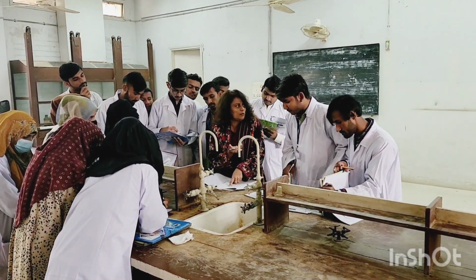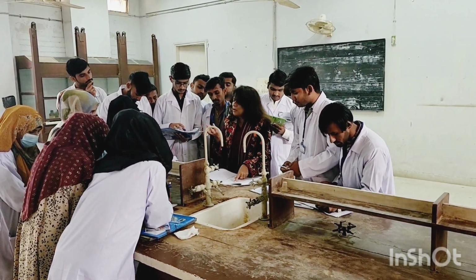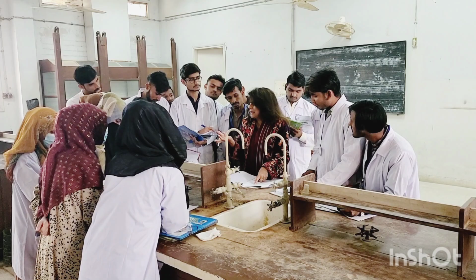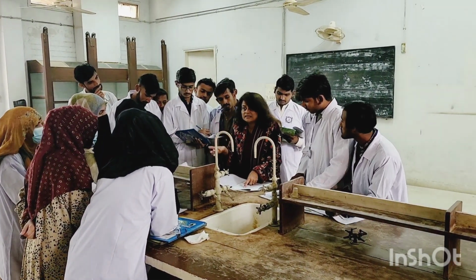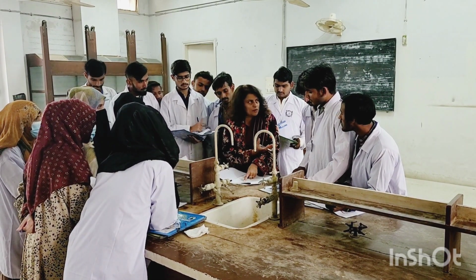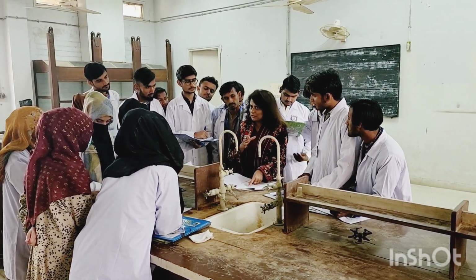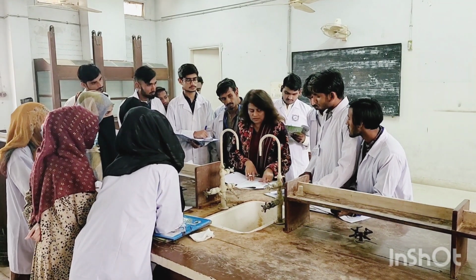This is what I have explained to you. The preliminary examination tells you about the nature of your organic compound and what type of compound it is, whether it is solid, liquid, whether it is pungent, has got odor, or is odorless, what type of pH it has, what litmus test it is going to give you, right? And is it a saturated compound or an unsaturated compound? For that you will go through the unsaturation test, that is the Baeyer's test, which you will come across.